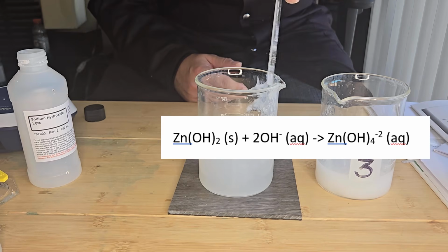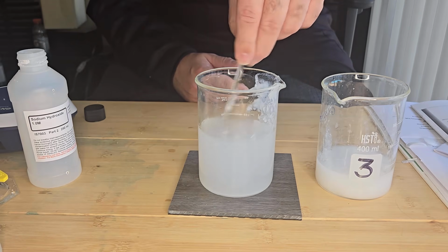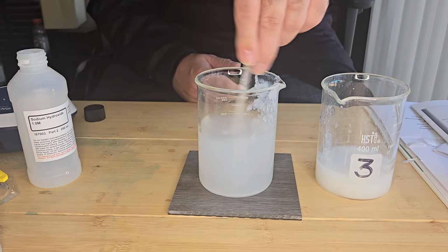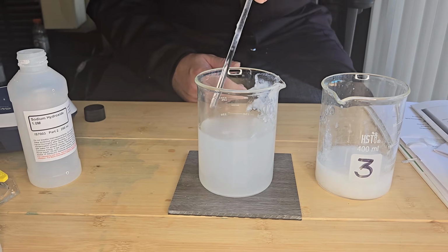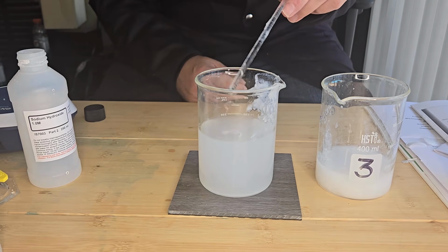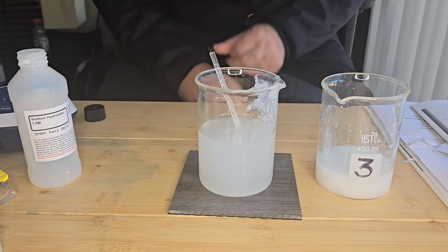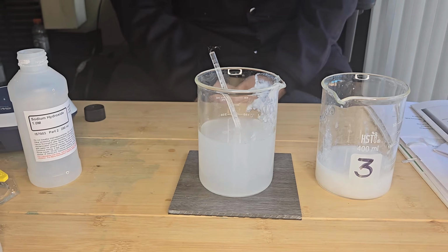So that gelatinous precipitate of zinc hydroxide has now become a zincate complex. So in strongly basic solution, zinc is soluble again. This reversibility is a sign of amphoteric behavior.